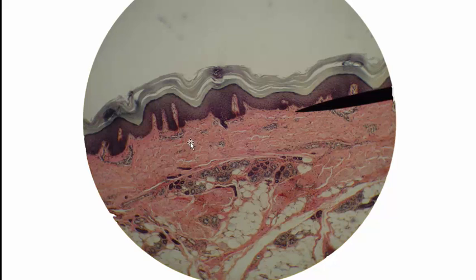And let's talk about some of the structures that we see. Apart from the layers, the majority of what I see here are sweat glands. These little tiny circles are sweat glands, collections of sweat glands. These are eccrine sweat glands, and they are coiled glands. So in this area, for example, it's really one tube that is coiled up around itself several times. And in cross-section, that creates this look of multiple circles.